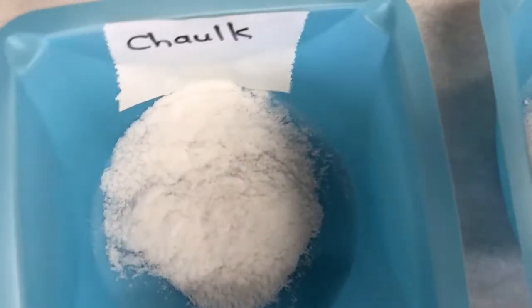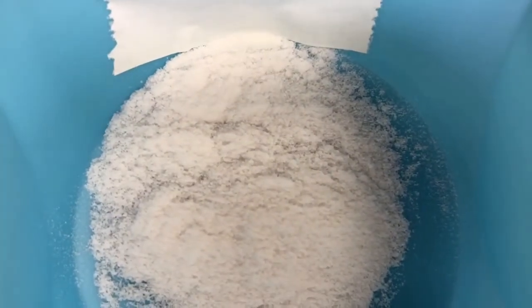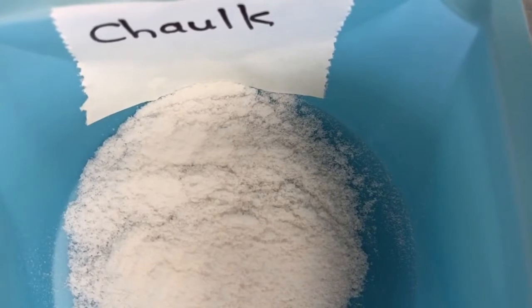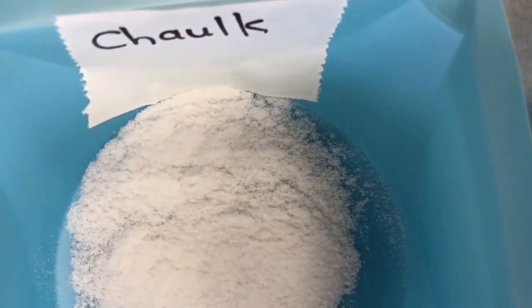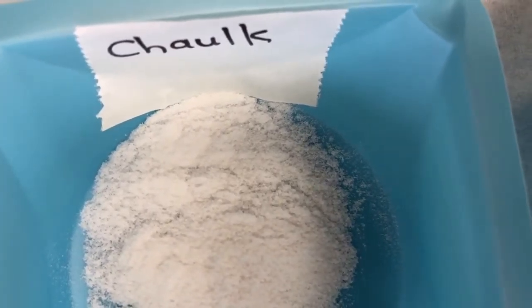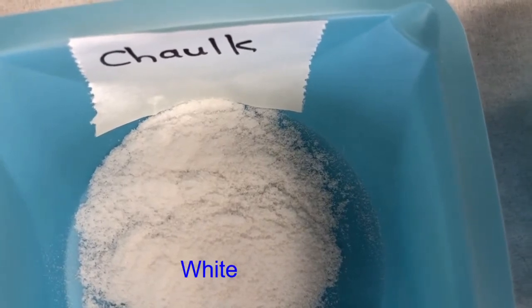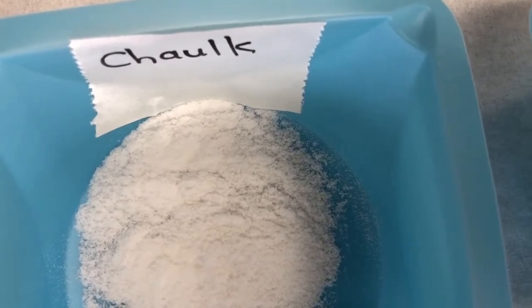If we focus in on chalk, chalk is actually more of a powder, not a crystal substance. With the other ones, you can see individual crystals. With the chalk, you don't really see the same crystal structure, and that's because chalk is a powder. So if we look at particle type, chalk is powder, where the other two were crystals. Chalk is actually white, because when we look at an individual piece of that powdered substance, it is white. It's not colorless like the other ones.